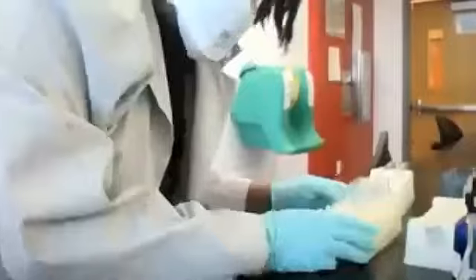With experiment 2, which is about chemical and physical changes. Make sure you have a good view of the tabletop.